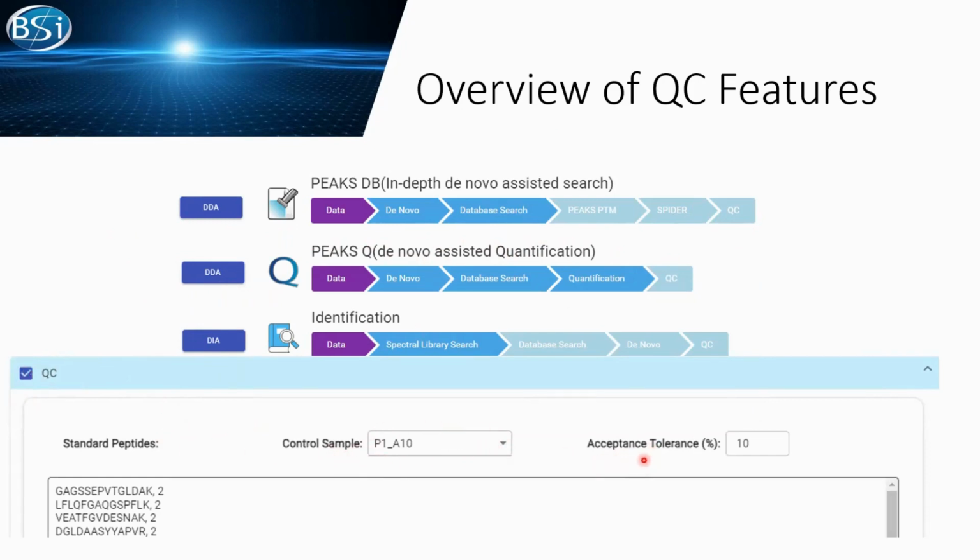You can set up your own accepted tolerance, plus minus 10. We'll set up here. Also, if you have any standard peptide that you would like to monitor in your QC process, you can also put in here.